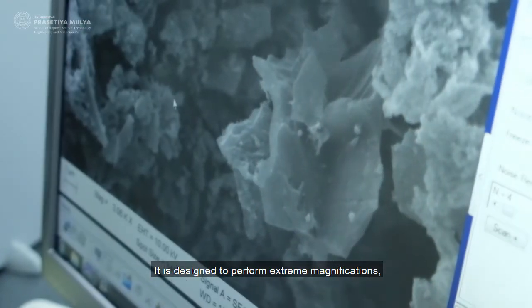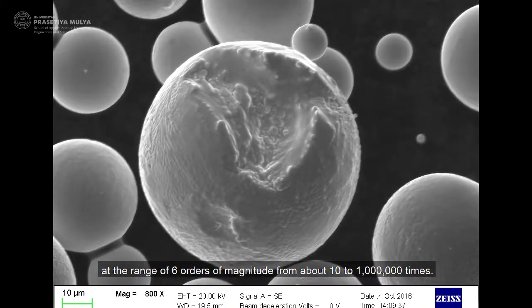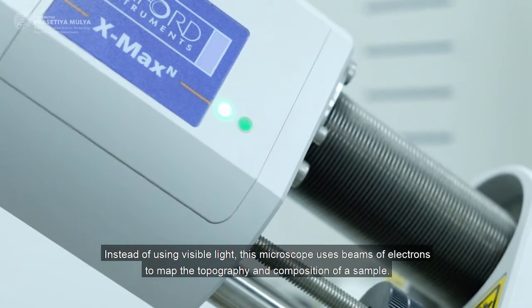It is designed to perform extreme magnifications at the range of 6 orders of magnitude from about 10 to 1 million times. Instead of using visible light, this microscope uses beams of electrons to map the topography and composition of a sample.